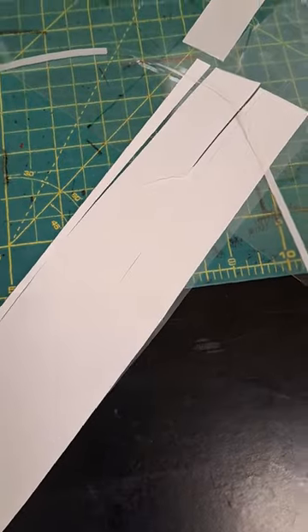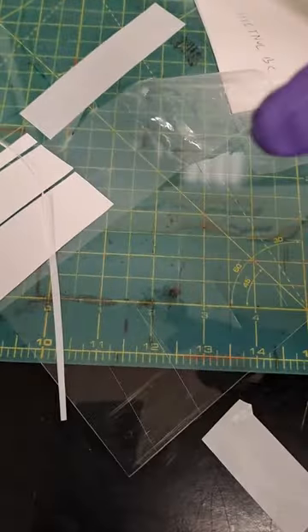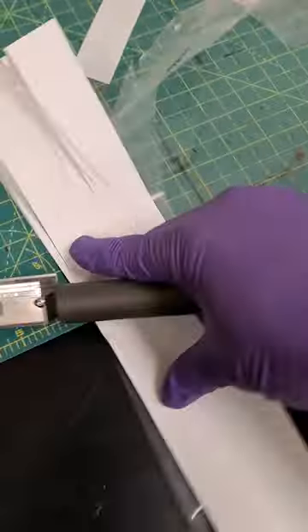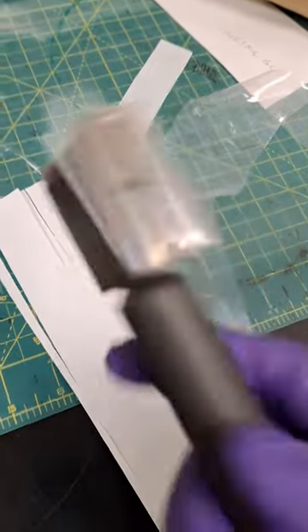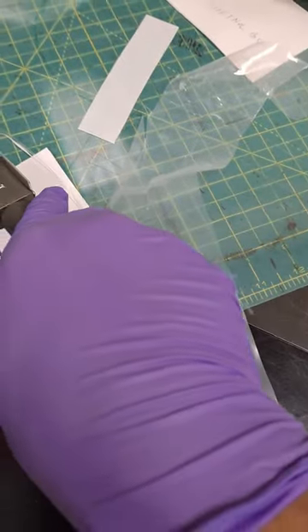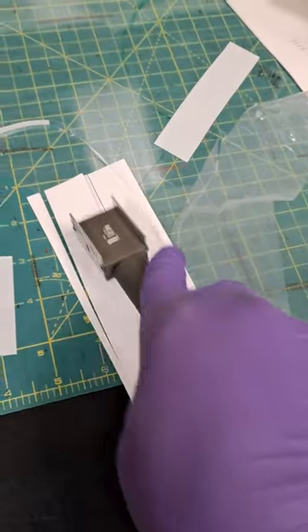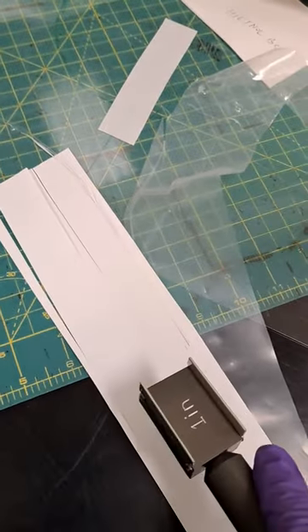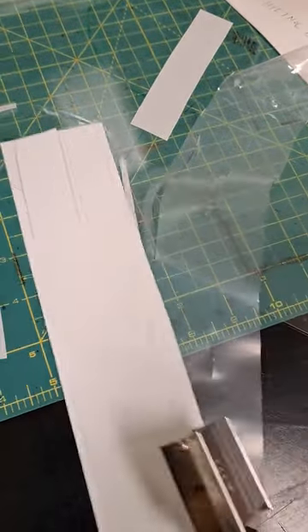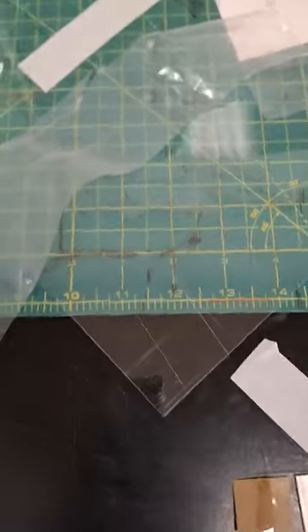What you need to do is using this cutter, you can cut it to 1 inch width. This is the tape I already cut.